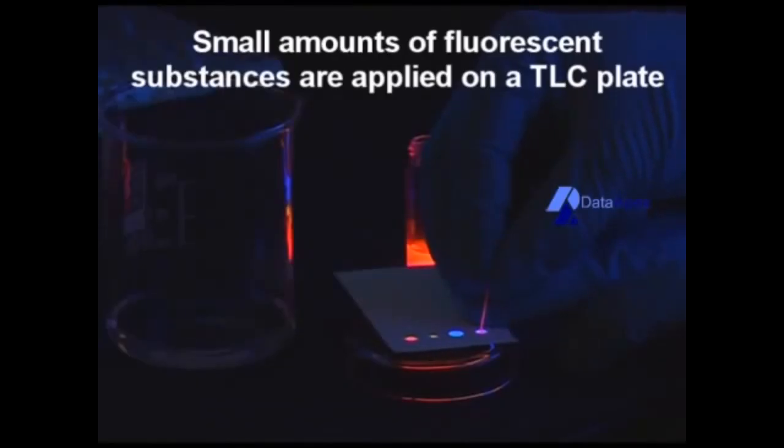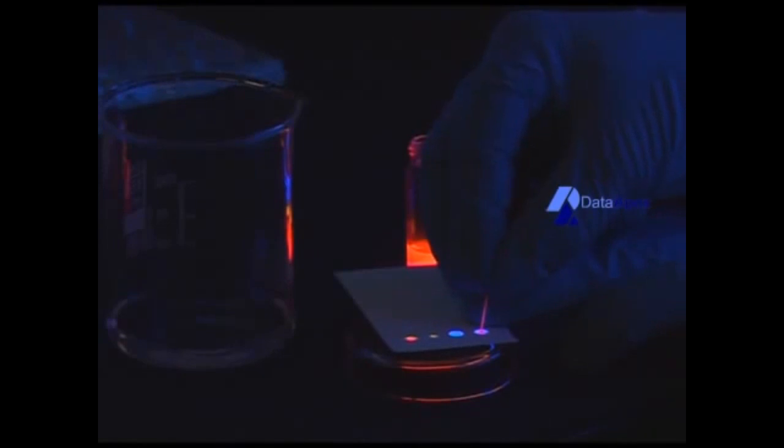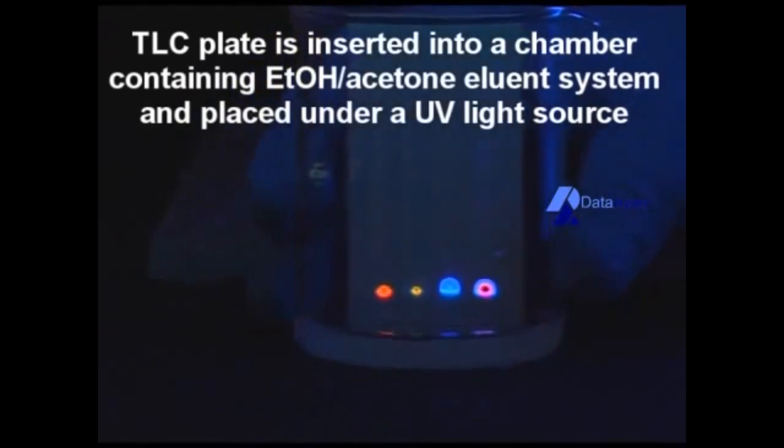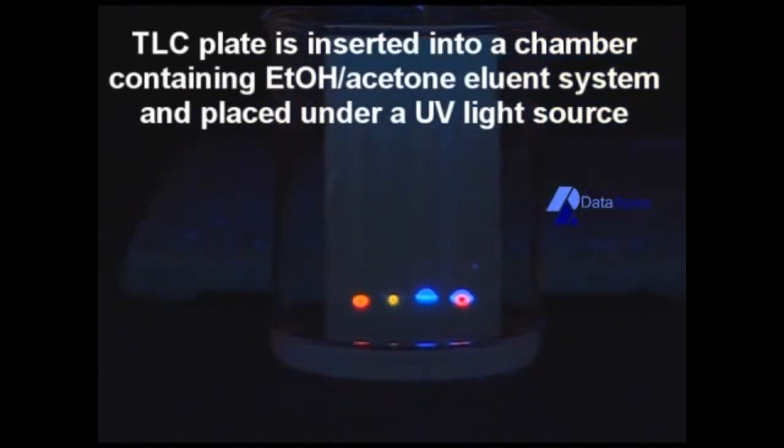Another example we will talk about fluorescent compounds. This experiment is done under ultraviolet light. As we can see all the compounds are fluorescent.